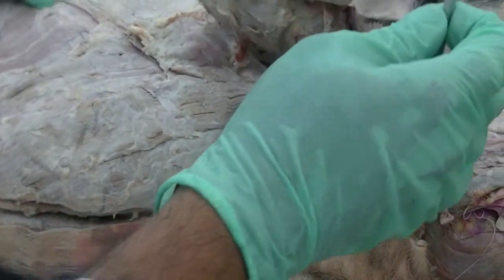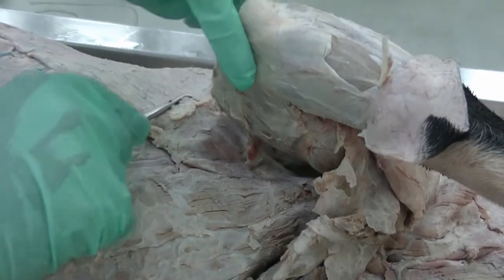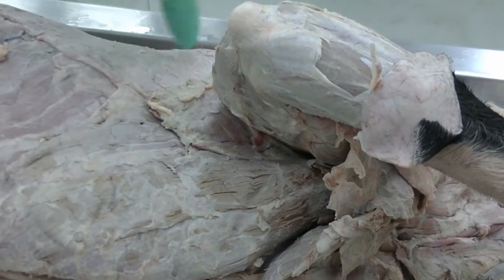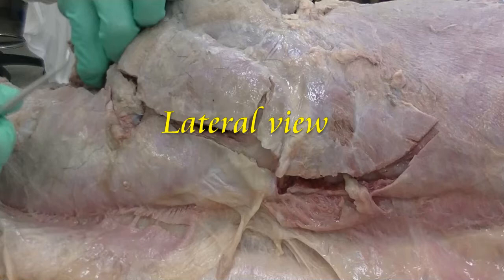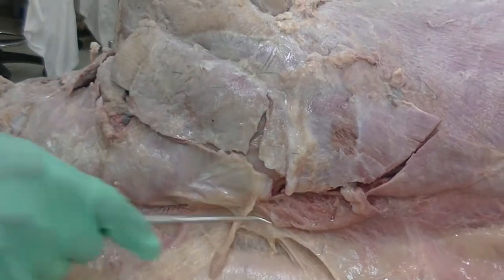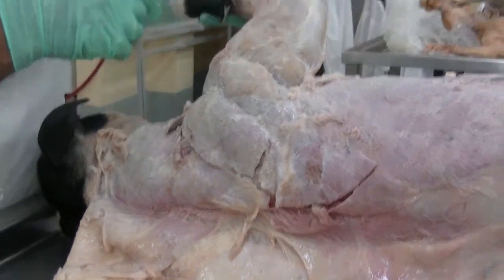In this dissection, we still see some leftover of the cutaneous trunci going deeper to get attached on the medial aspect of the humerus, as well as latissimus dorsi can still be seen as we move around the forelimb or scapula, which attaches the forelimb to the rest of the body. On the lateral side, we see the dorsal aspect or dorsal midline and the shoulder region of the forelimb, brachium of the forelimb, antebrachium of the forelimb, and manus of the forelimb.